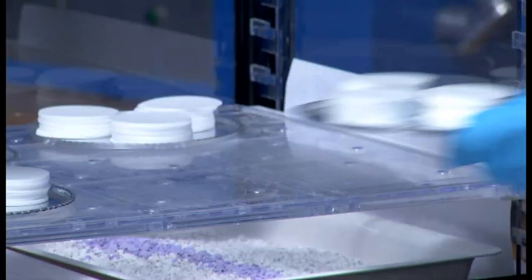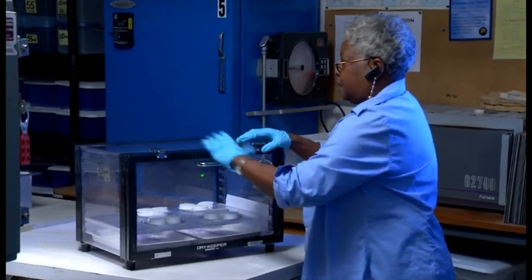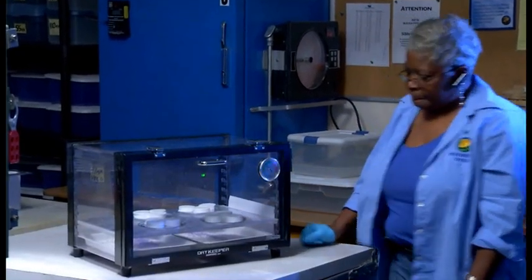The filters are cooled and stored in a desiccator for removal of all moisture. They remain in the desiccator for a minimum of two hours or until the weighing process begins.